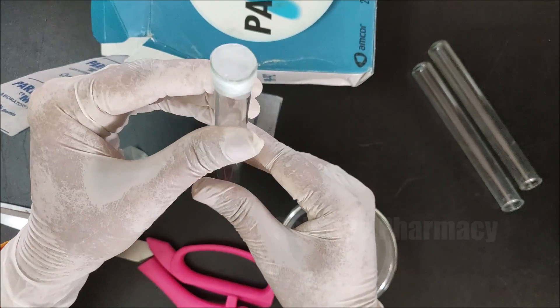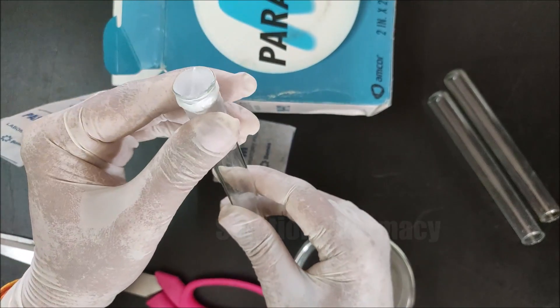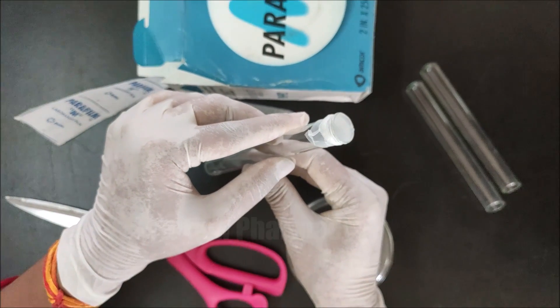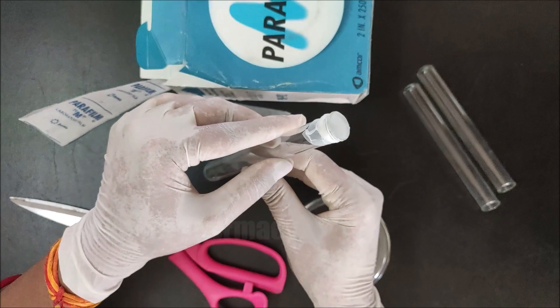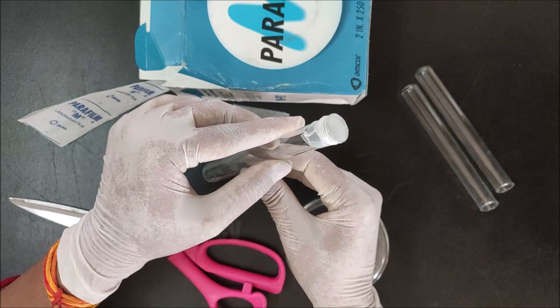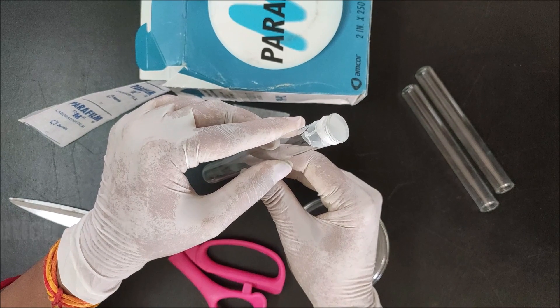Press the wrapped parafilm around the test tube properly. Now our test tube is properly sealed, and any liquid present inside will not leak out. When we invert the test tube, the liquid will not come out. Now we will show a demo for this liquid-proof sealing using parafilm.